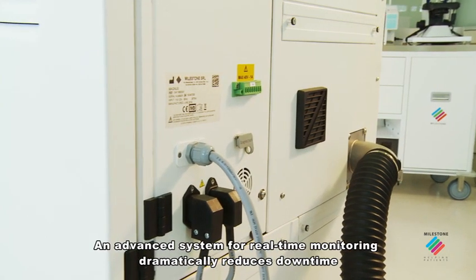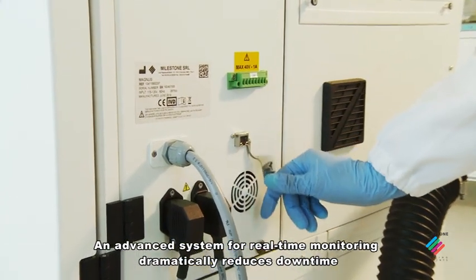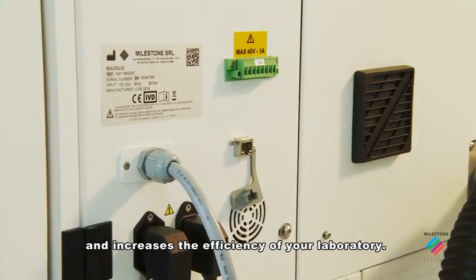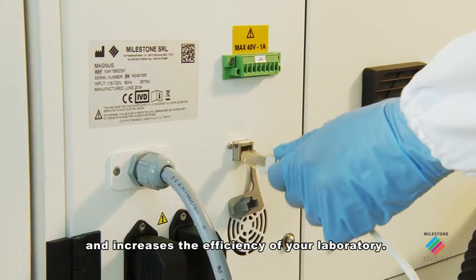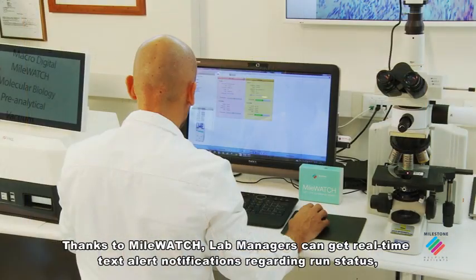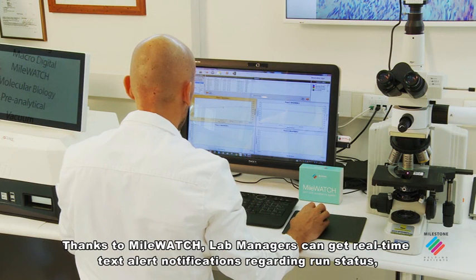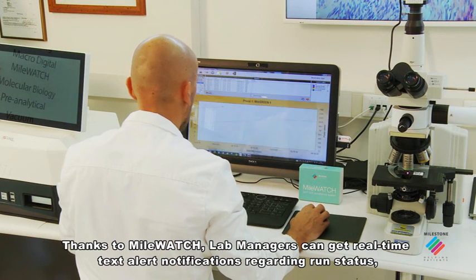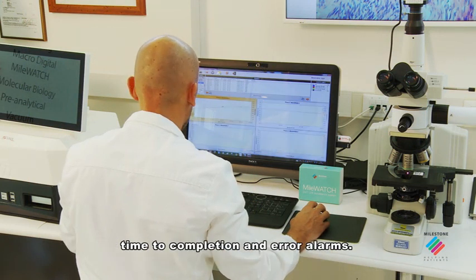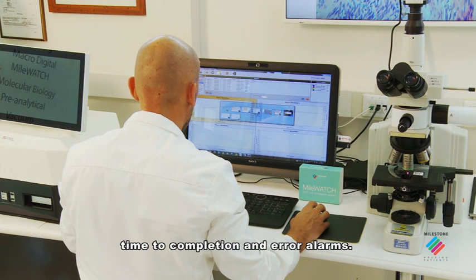An advanced system for real-time monitoring dramatically reduces downtime and increases the efficiency of your laboratory. Thanks to MileWatch, lab managers can get real-time text alert notifications regarding run status, time to completion and error alarms.